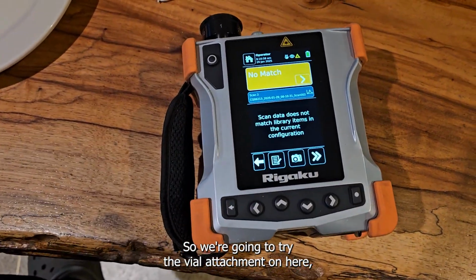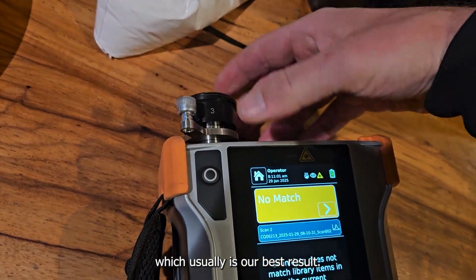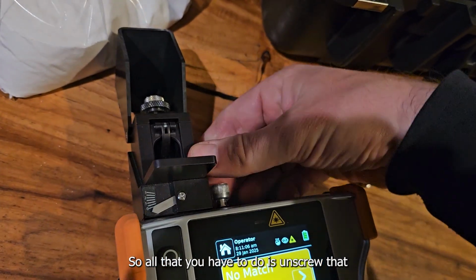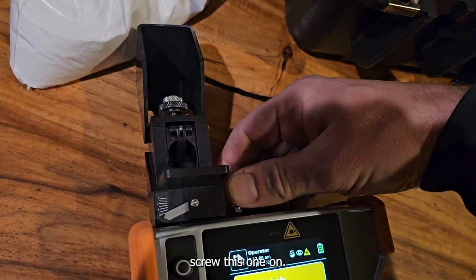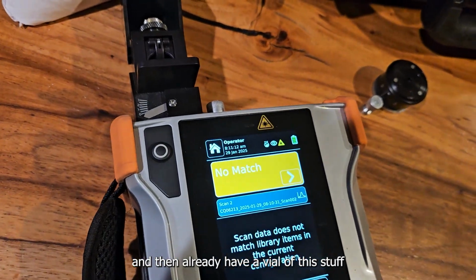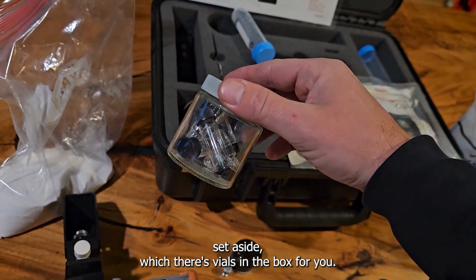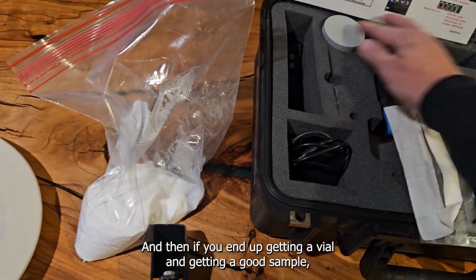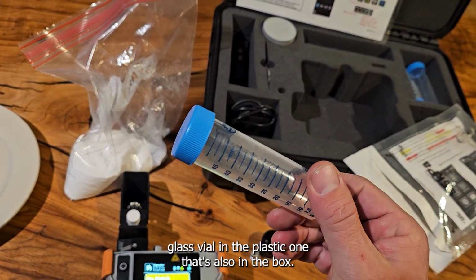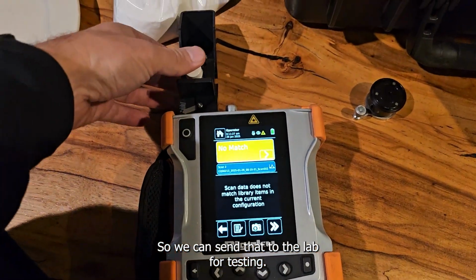So we're going to try the vial attachment on here, which usually is our best result. All you have to do is unscrew that, screw this one on. Sorry if there's a lot of motion in the camera. And then I already have a vial of this stuff set aside, and there are vials in the box for you. If you end up getting a good sample in a vial and you go to send it off, you could put that glass vial in the plastic one that's also in the box, so we could send that to the lab for testing.